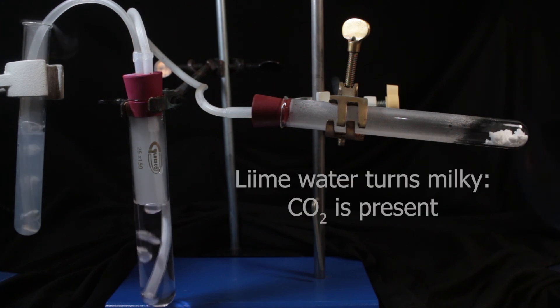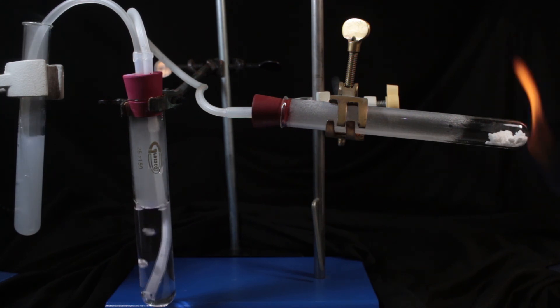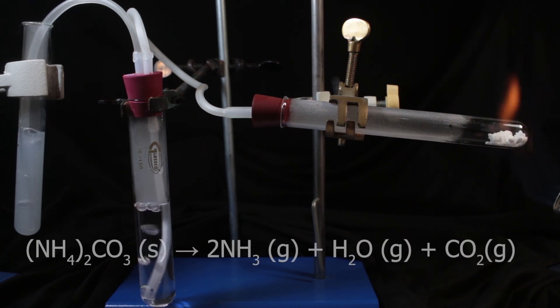Yes, it's a success. Lime water turns milky. We have proven the presence of carbon dioxide, third constituent. So we have shown that ammonium carbonate is decomposing, producing at least ammonia, water, and carbon dioxide.